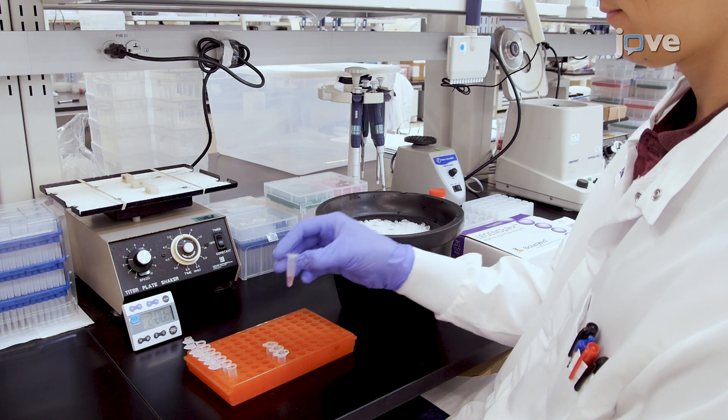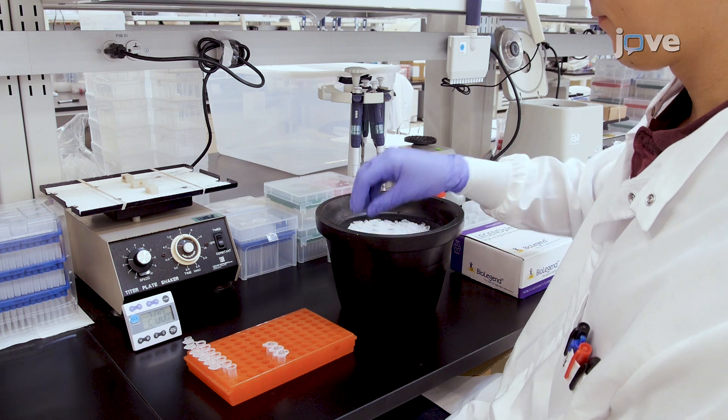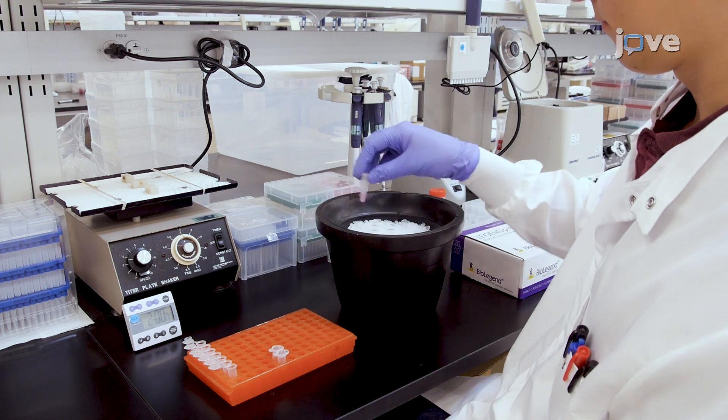Begin this procedure with biological sample preparation as described in the text protocol.